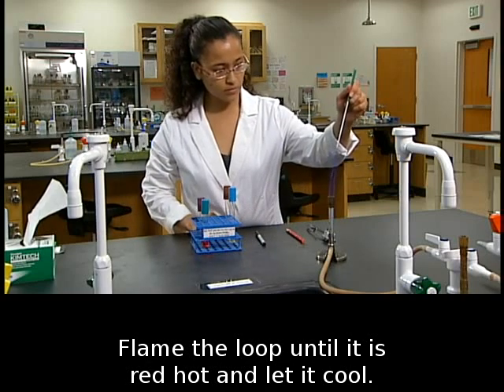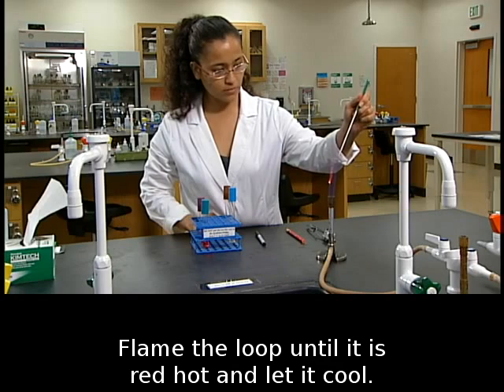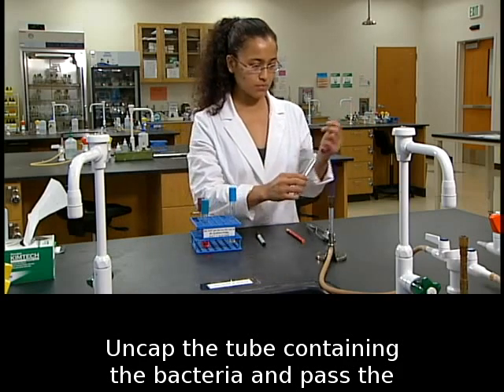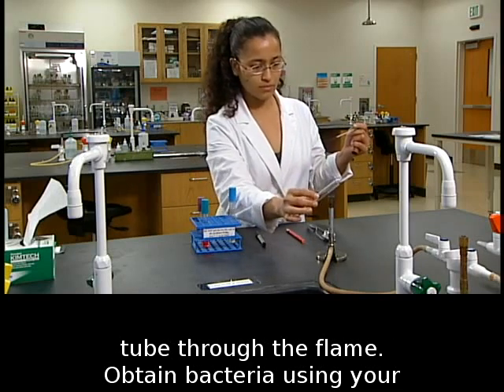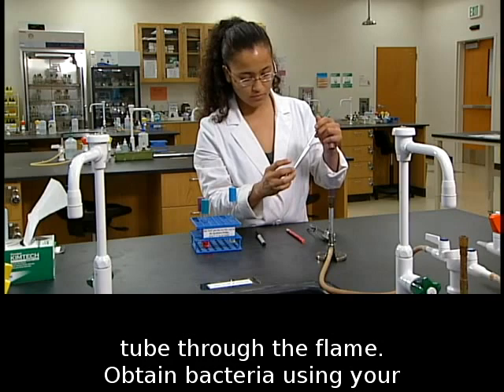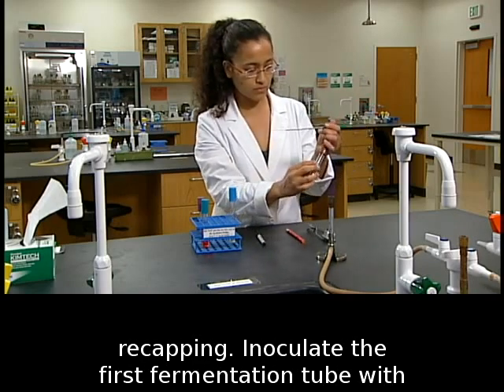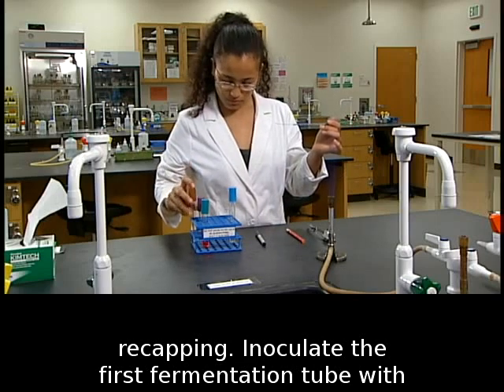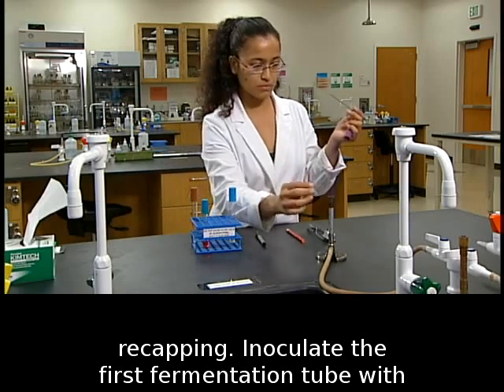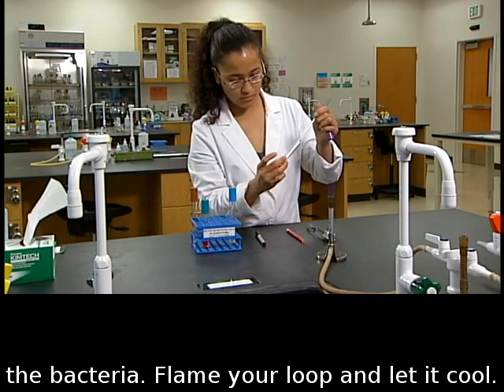Flame the loop until it is red hot and let it cool. Uncap the tube containing the bacteria and pass the tube through the flame. Obtain bacteria using your loop and pass the tube back through the flame before recapping. Inoculate the first fermentation tube with the bacteria.